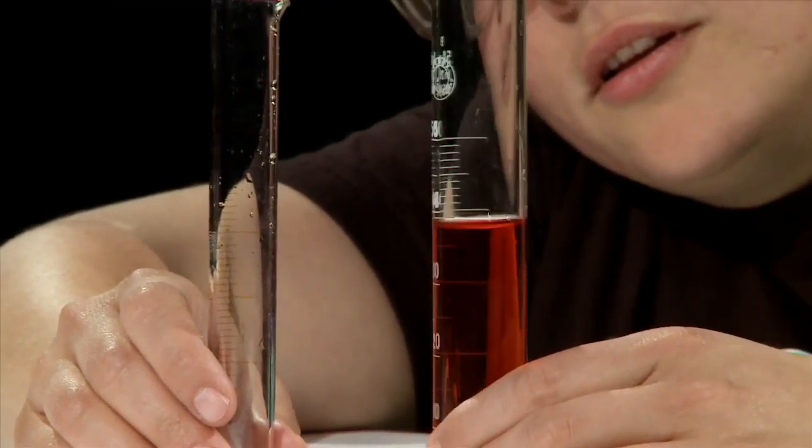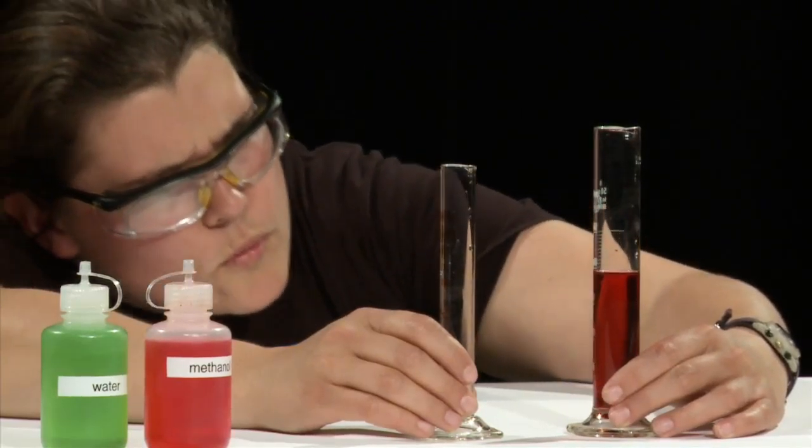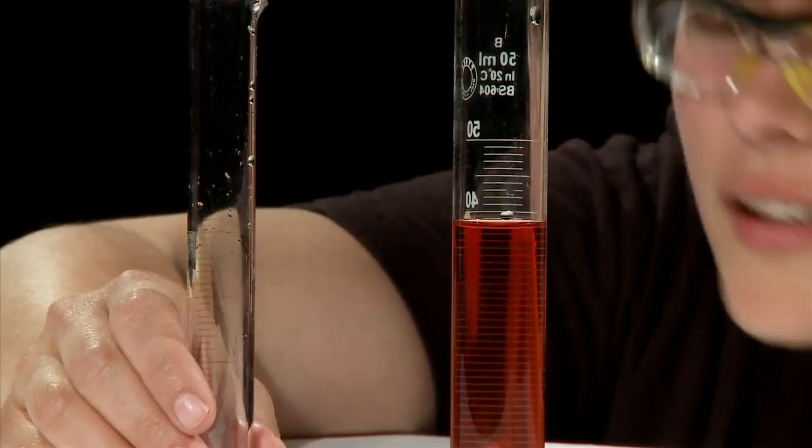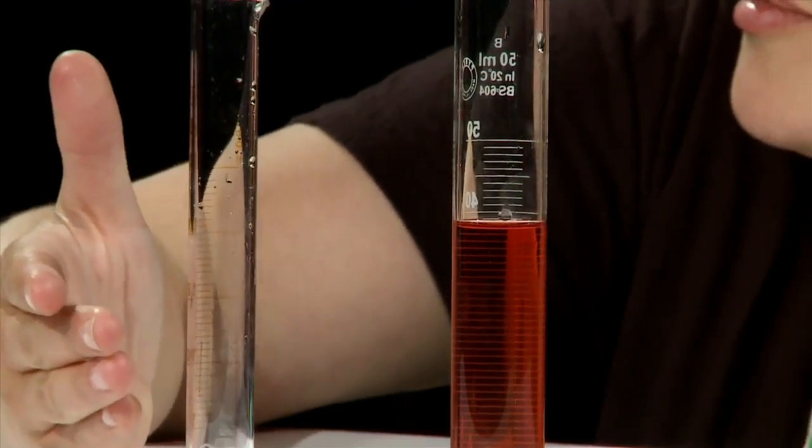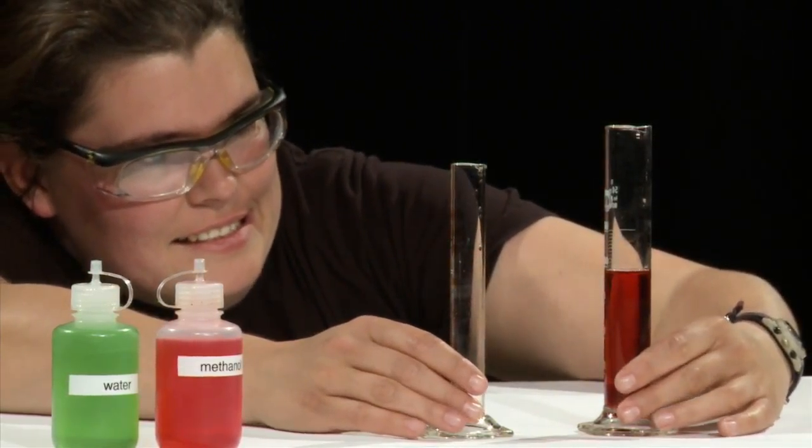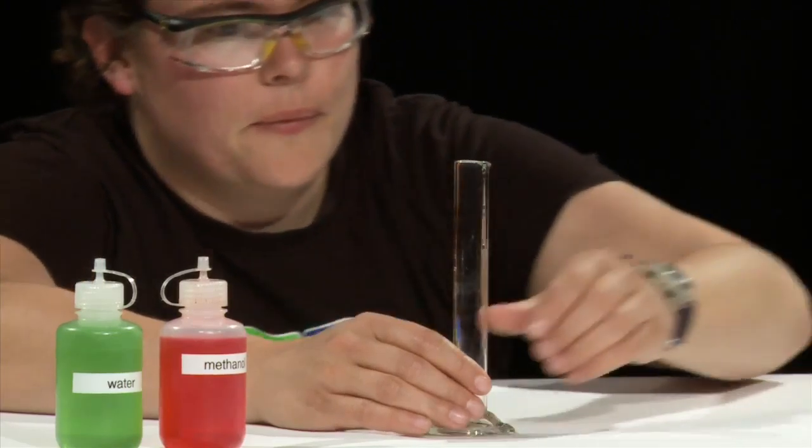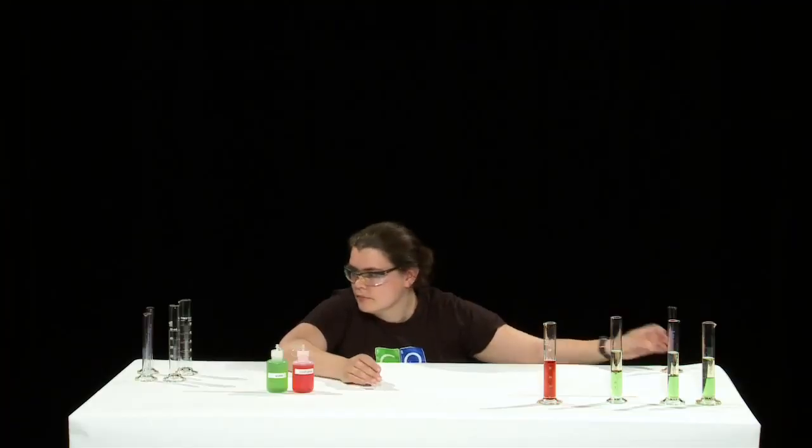Now what's the final volume Trudy? 39? 39? Obviously our good student has finally made a mistake. Well it's a good thing in science we repeat our experiments. Trudy will now repeat this twice more.